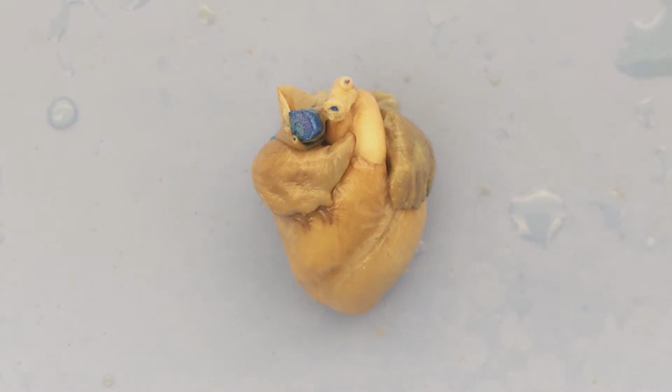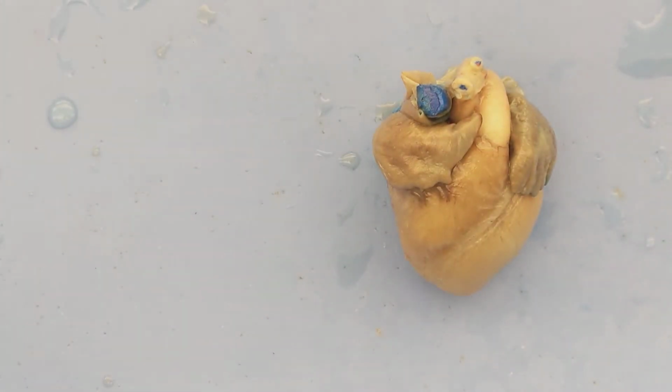So let's talk a little bit more about the fetal pig heart. As I mentioned before, the fetal pig heart is similar to our heart in many ways. It has 4 chambers. The flow of blood is the same. So let's talk about it a little bit more. Those of you who go on to take human anatomy and physiology will probably talk about human hearts a little more, and this is a nice primer for that.